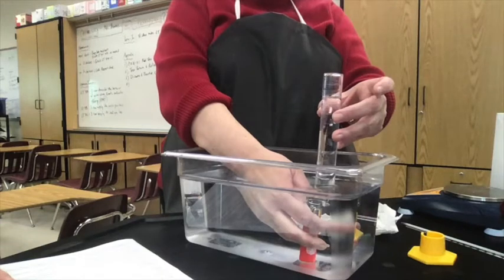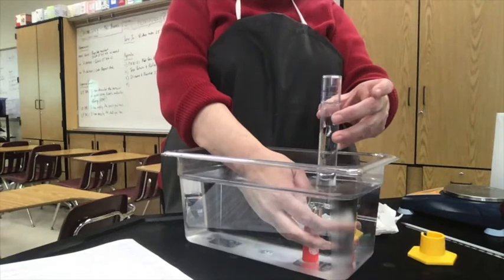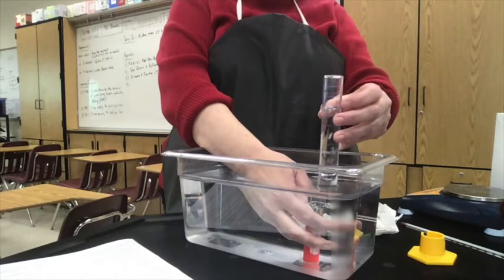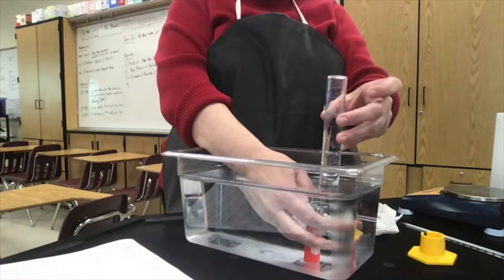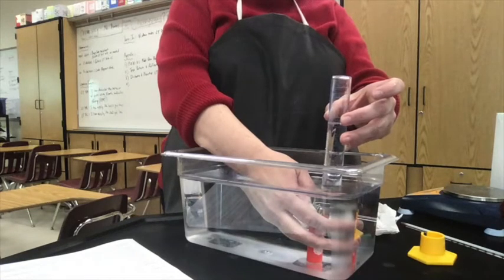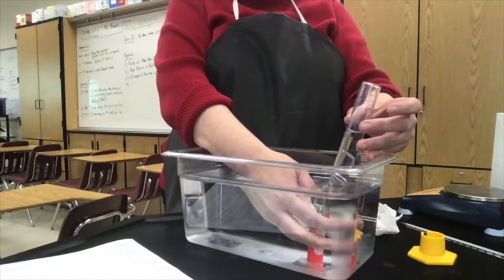And an important thing that happens when you're collecting a gas this way is that you're actually not just collecting butane gas. That water vapor sitting at the top of the surface right there, based on the temperature that everything is at, has the ability to escape and exist up here with the butane gas, and that's known as water vapor pressure. And it's something that we're going to have to account for in our calculations, where we are going to have to look up the water vapor pressure at whatever temperature we read on our thermometer and make a correction to our pressure, so that we have what we call the pressure of the dry butane.